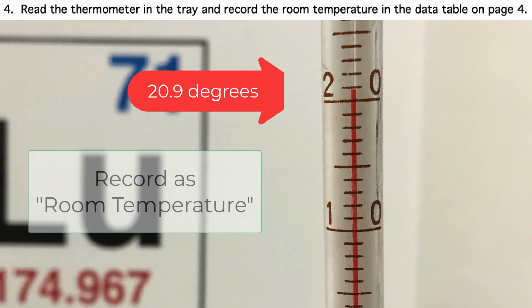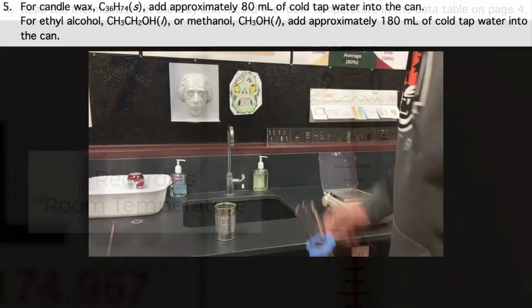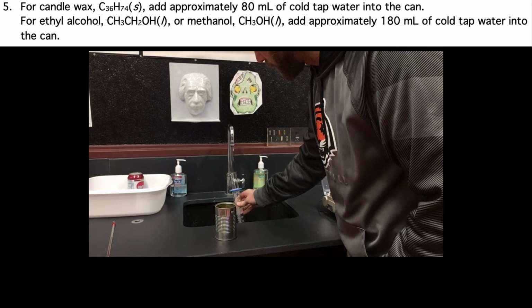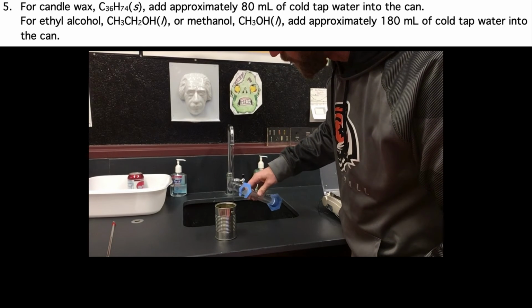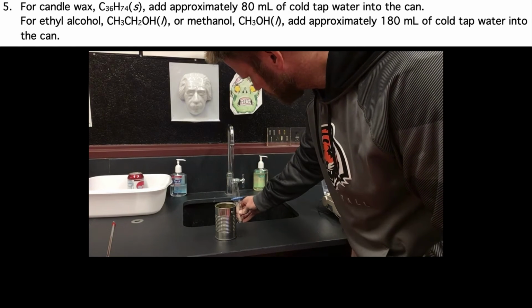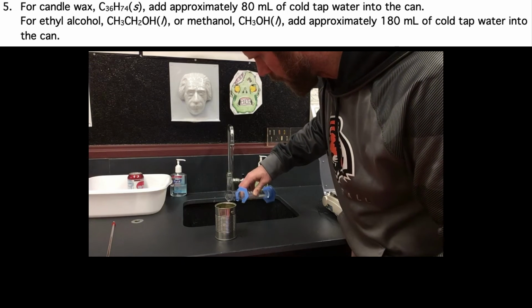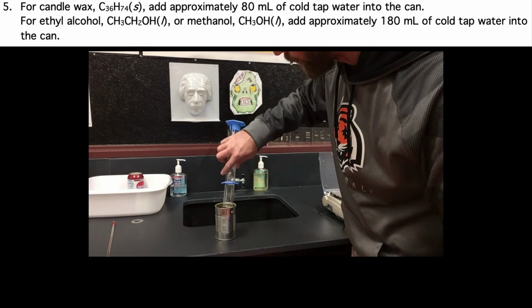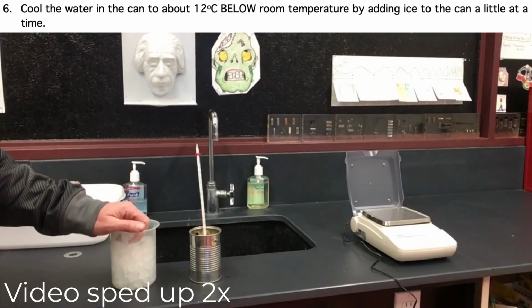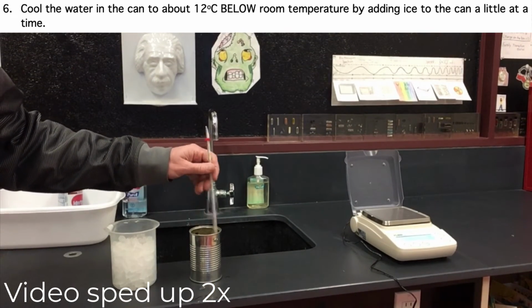Now, let's get room temperature. Room temperature is 20.9 degrees. Make sure that goes in the data table. Next, we are going to add 180 milliliters of tap water to the empty can. Now we want to cool down this water to about 12 degrees below that room temperature we recorded.